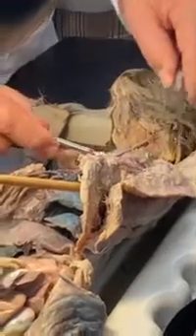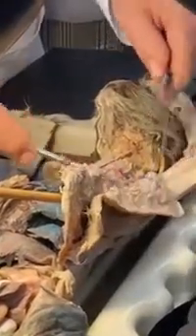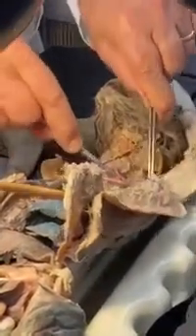How do I know this is long thoracic? It's going to this. S, subscapular, going down deep. This is the subscapular, going down deep. And out here, brachial. That's it. That's your upper arteries. Let's do the lower arteries.